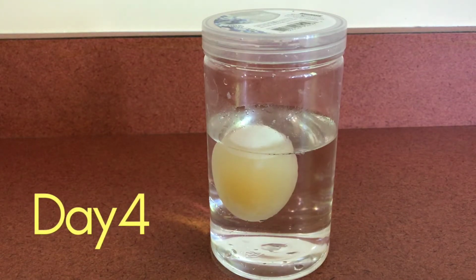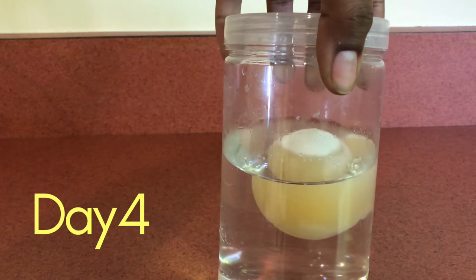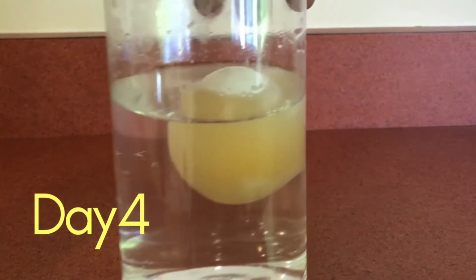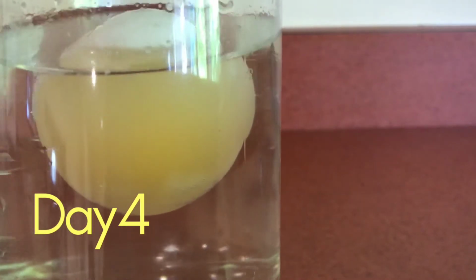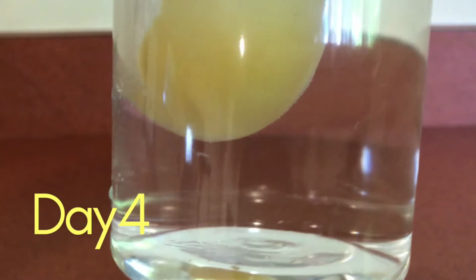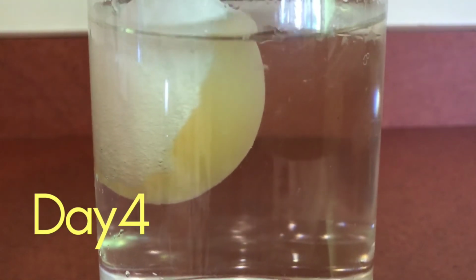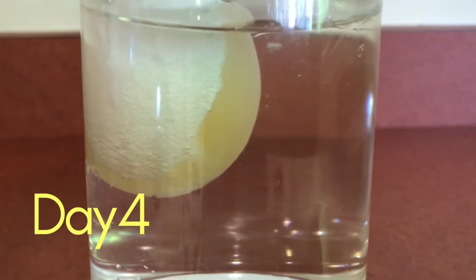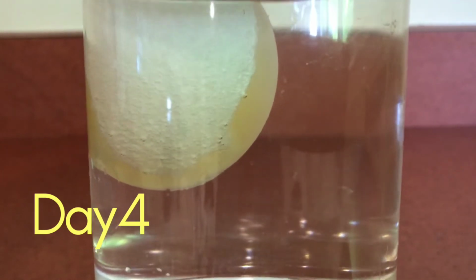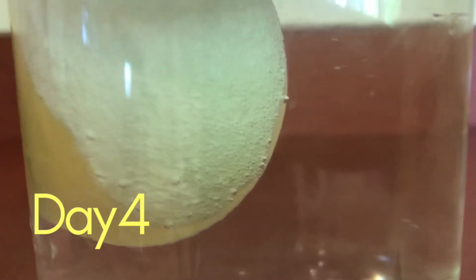Wow, day 4. Look at our naked egg. We can almost see completely through it. Right at the top, you can see there is some white. That's what's remaining. And then as I circle the naked egg around, we've still got a little bit more on that other side that's trying to break down. You can see those bubbles really up close.